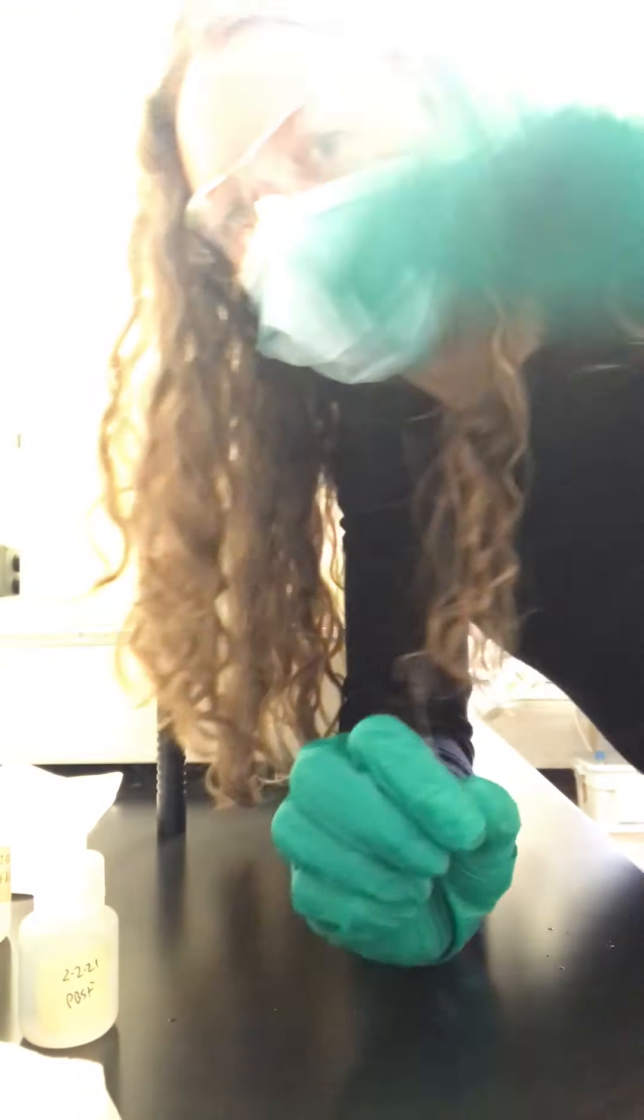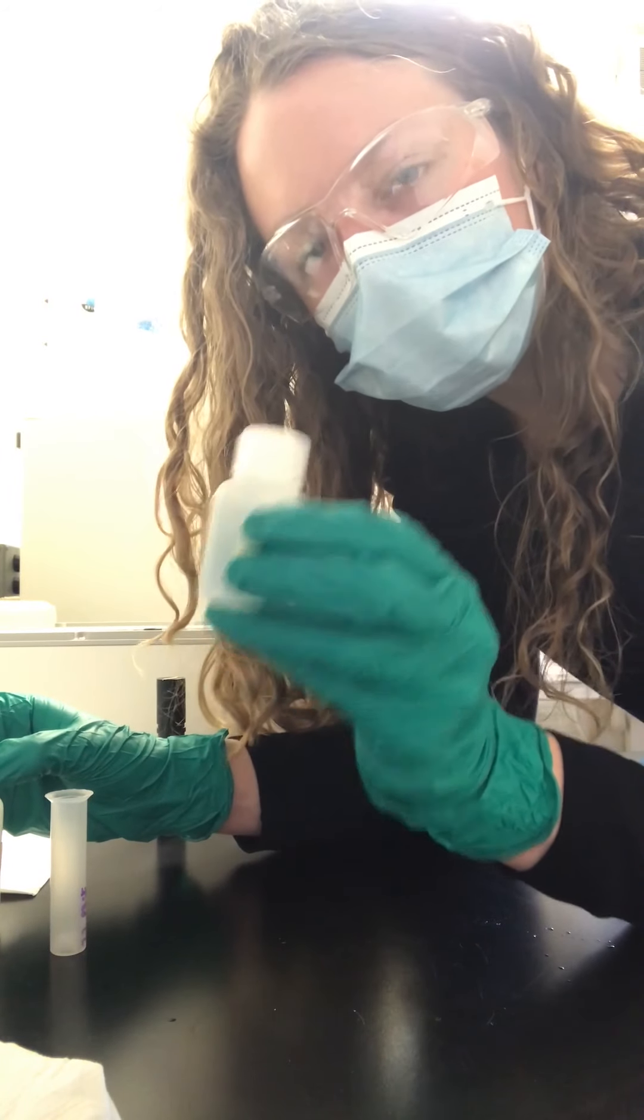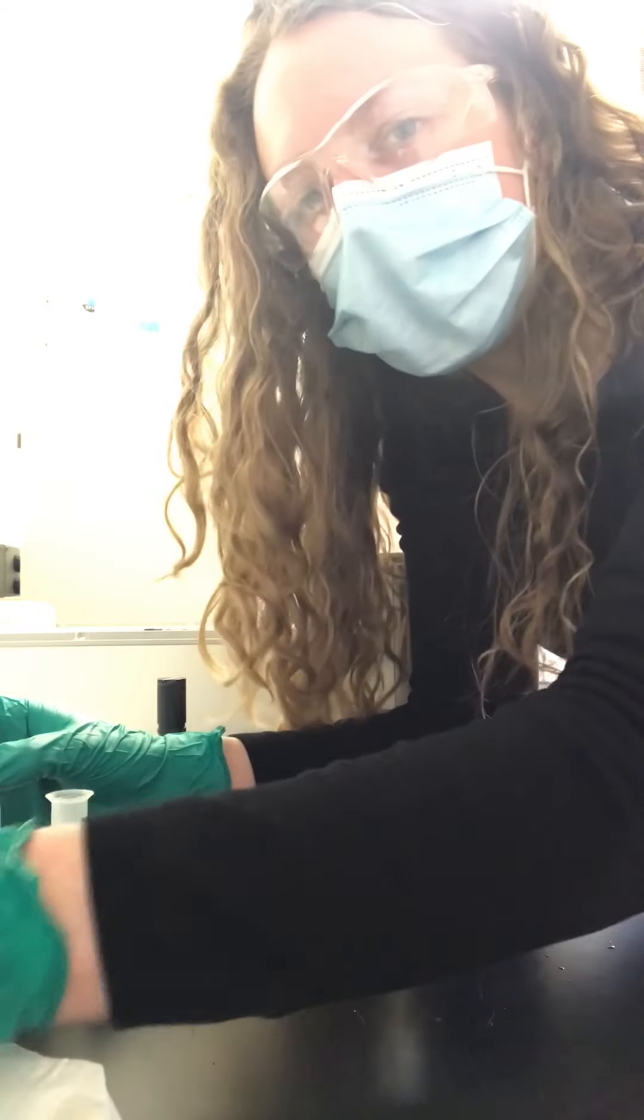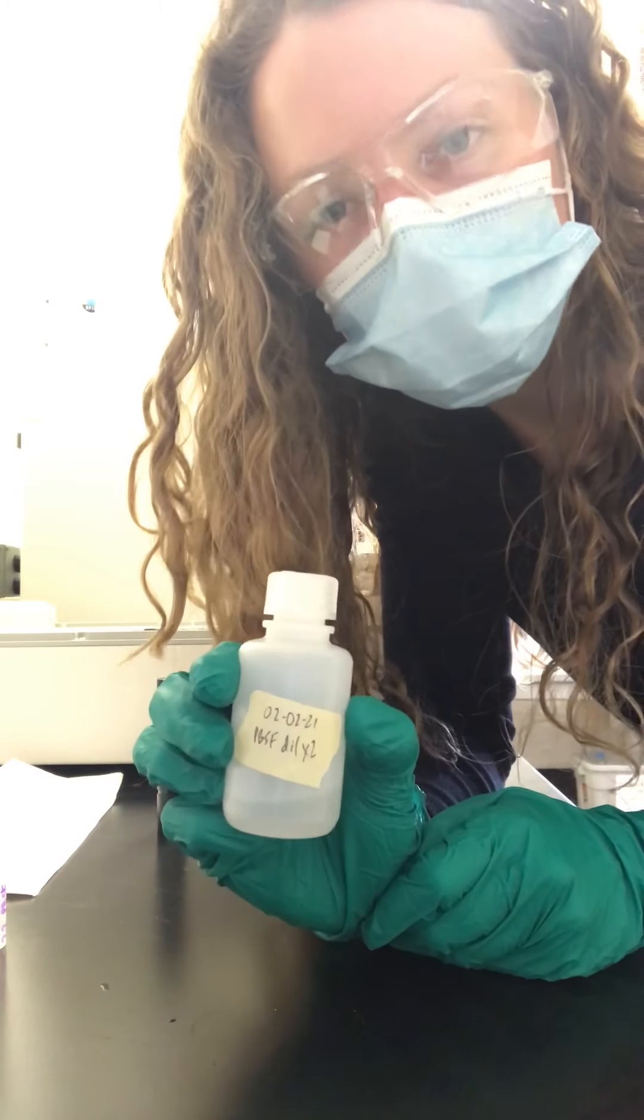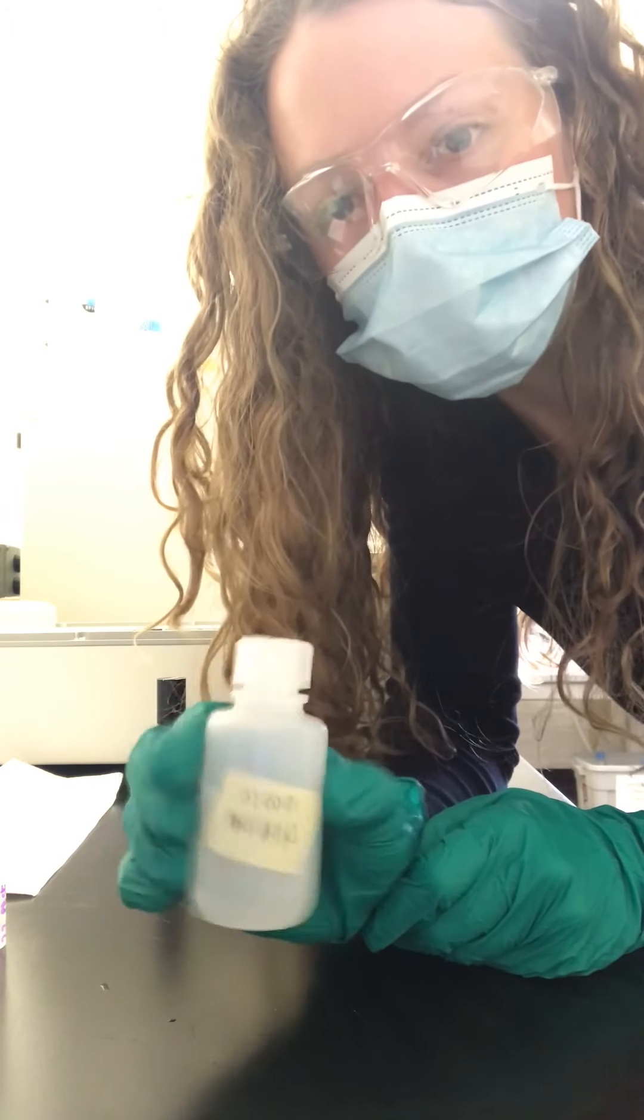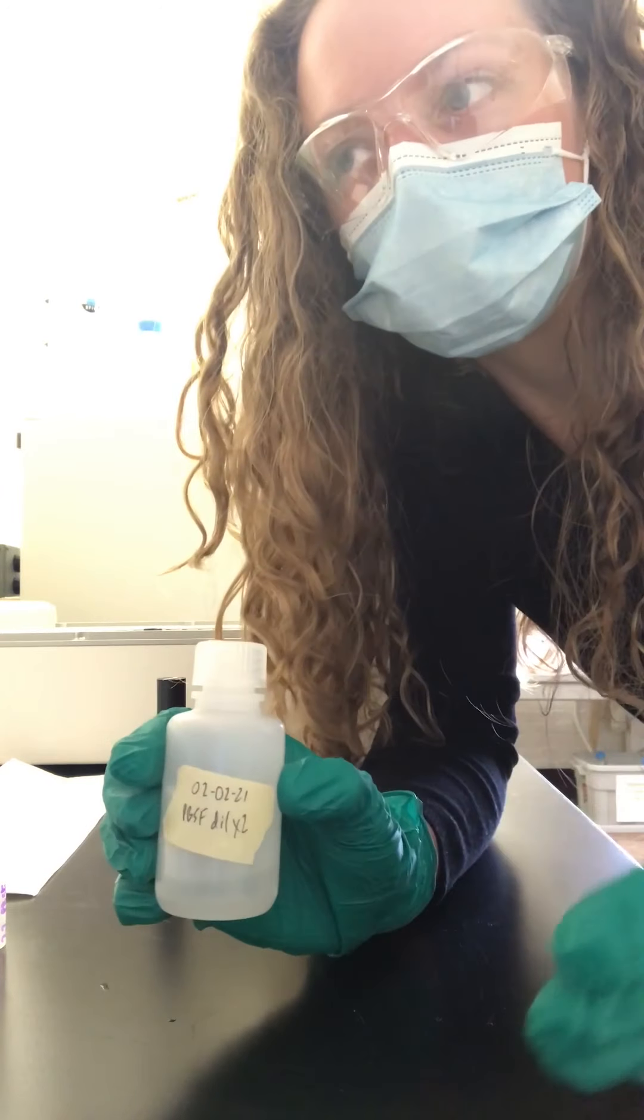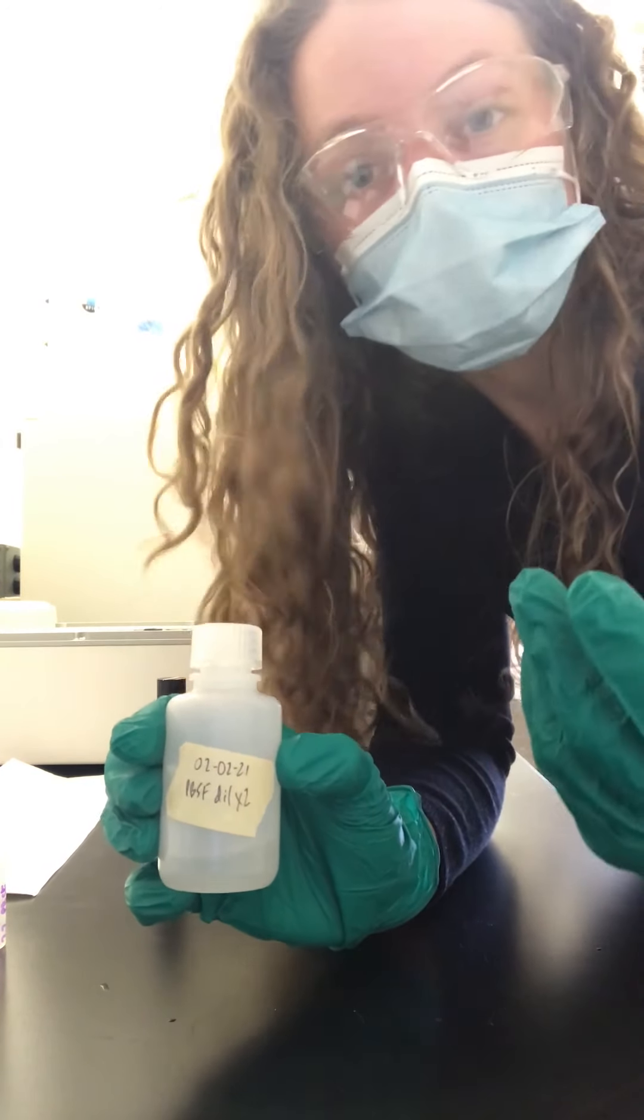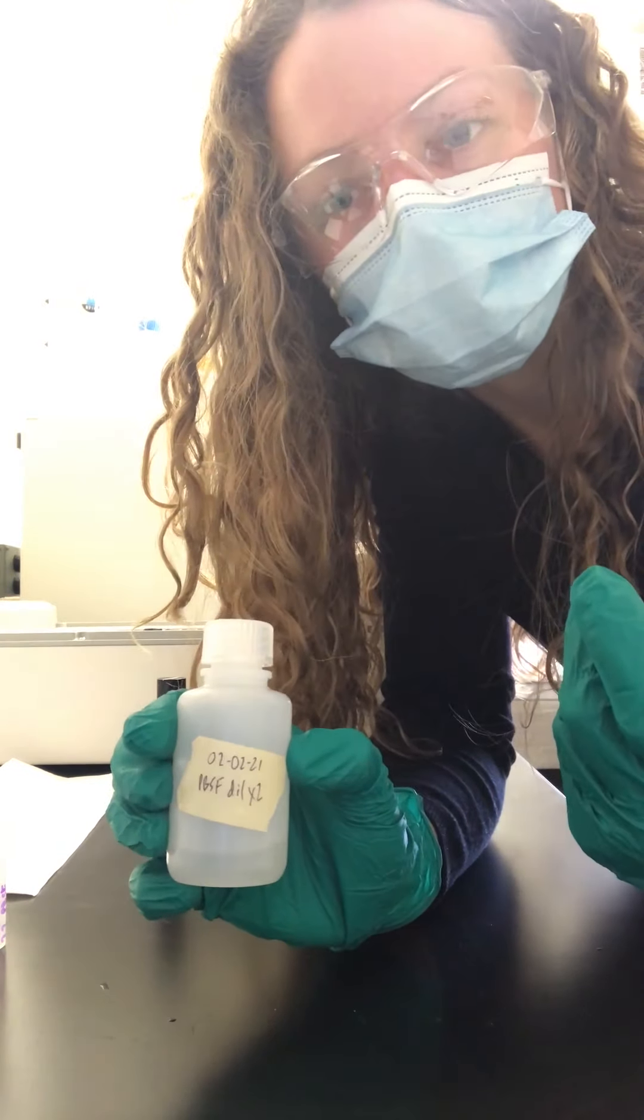Before I run the sample, I take 5 milliliters of my water sample from the creek and dilute that with an equal amount, 5 milliliters, of ultrapure water. Now the sample is diluted two times, so the machine is able to detect it, and then I just multiply what it detects by two to give us the actual concentration.